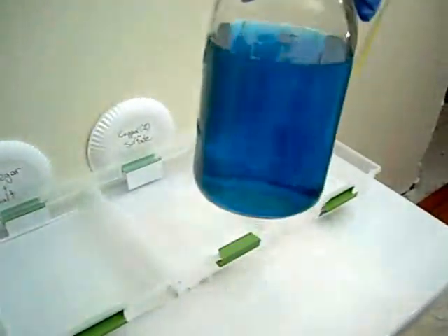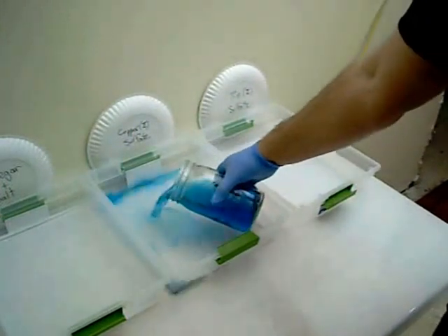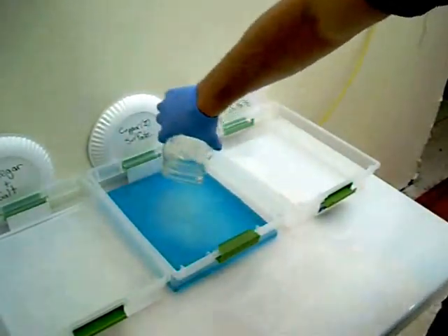Now after about an hour and a half or so, we end up with this pretty blue solution here. Just pour it into the bin there.